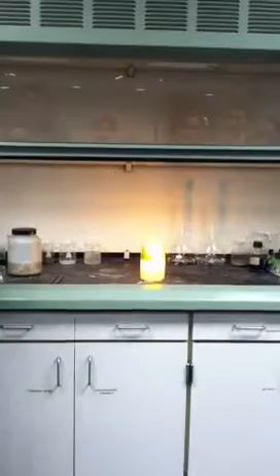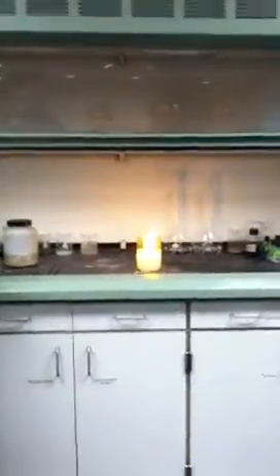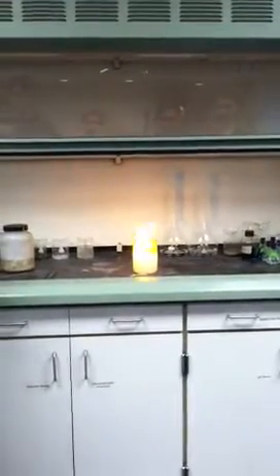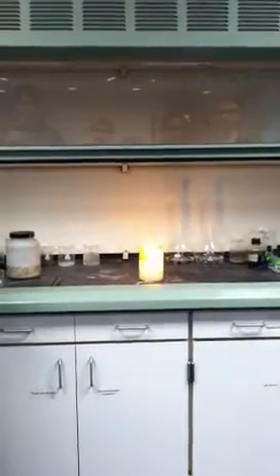Yay! It explodes and sparks again. No! No! What is that? It's turning into a... Yeah, it's like a hand grenade. We saw it, remember?